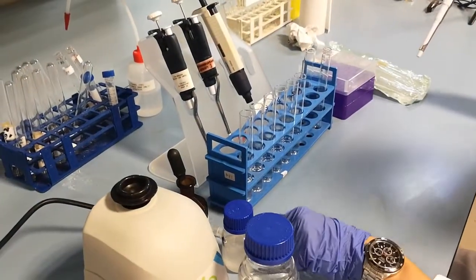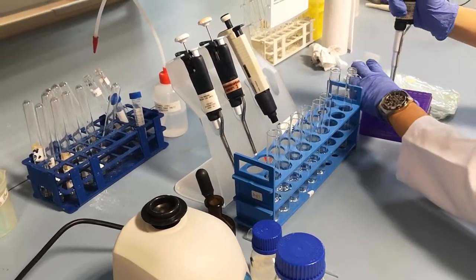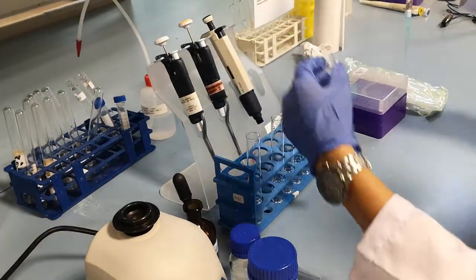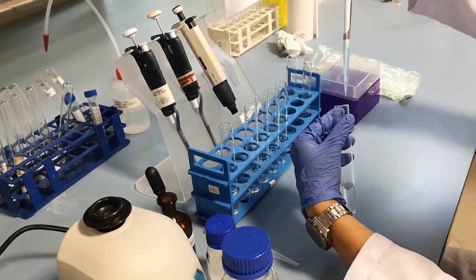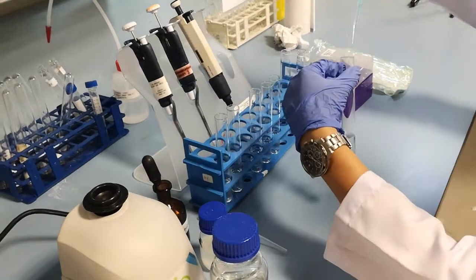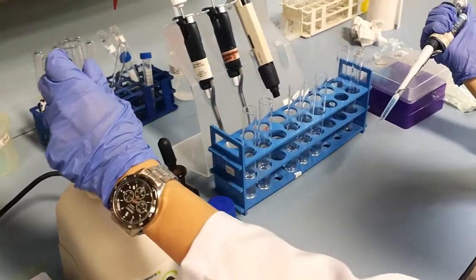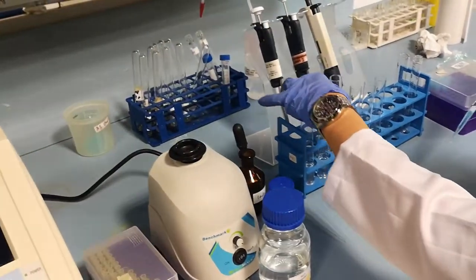Change tips in between every transfer. Take 1 ml of test tube 2 and transfer it into the next test tube containing 9 ml of distilled water. Mix the solution well and leave it to settle. Label this test tube as 3.